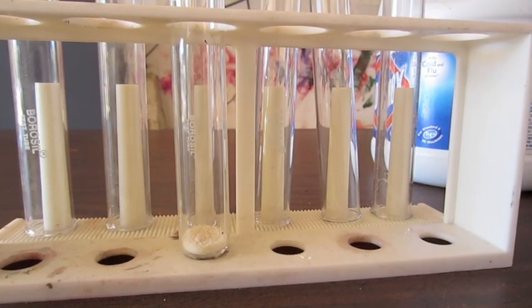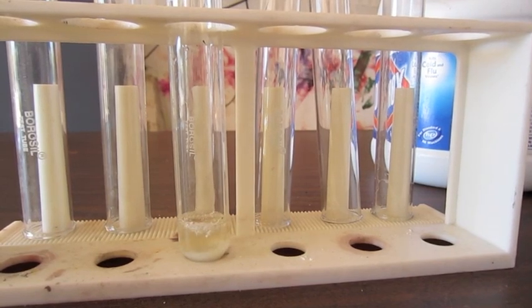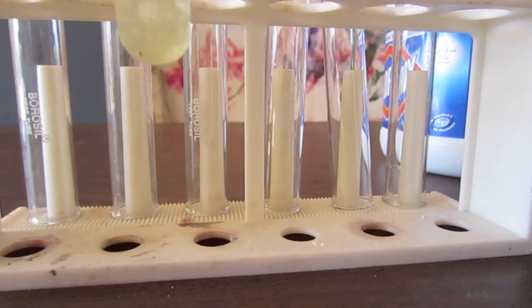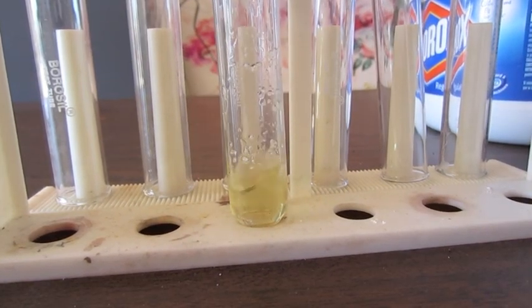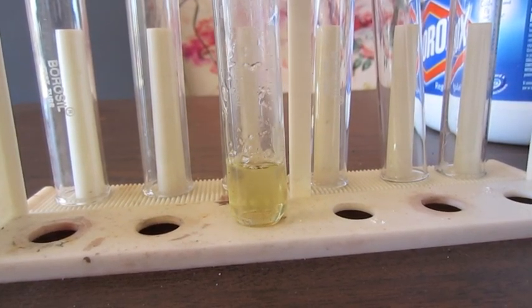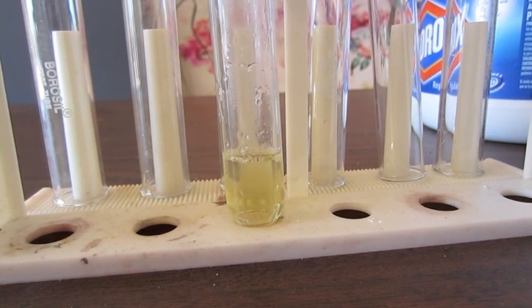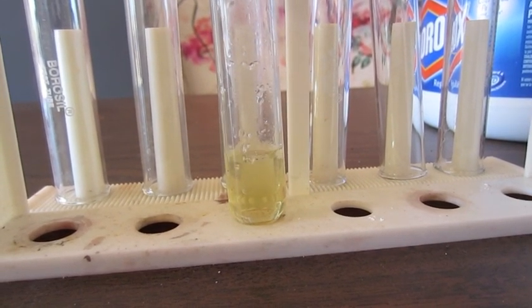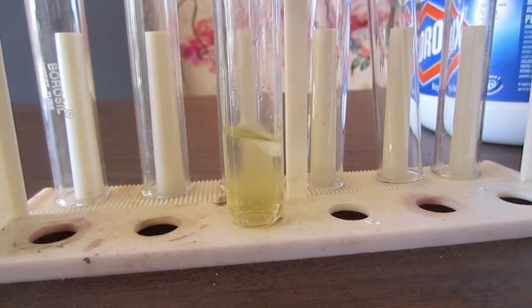Okay, here is some potassium iodide, and I'm adding just a little bit of water to it just so it dissolves. As you can see, it dissolves quite easily. Here I've got the solution, and now I'm adding a little bit of hydrochloric acid. What's going on is there's a double displacement reaction where I start with hydrochloric acid and potassium iodide, and I end up with hydroiodic acid and potassium chloride.